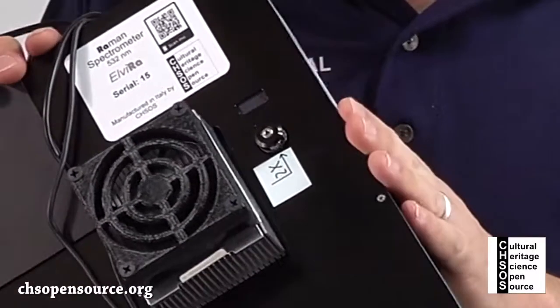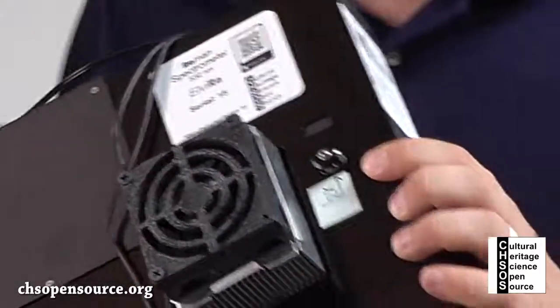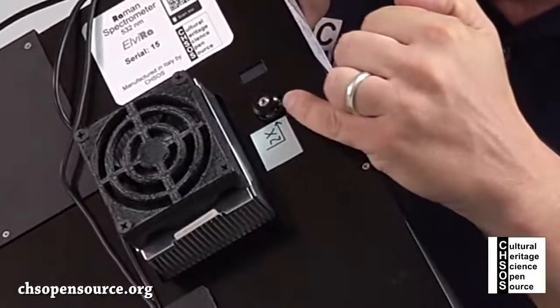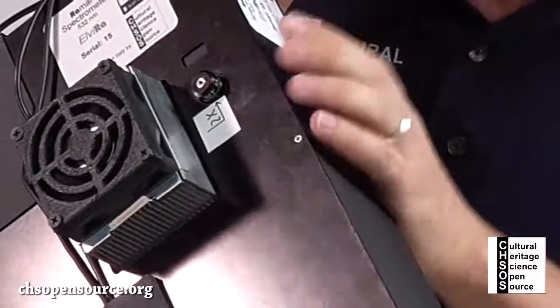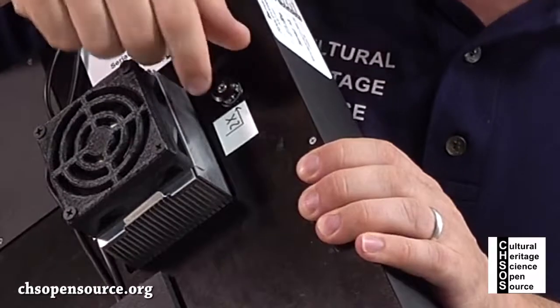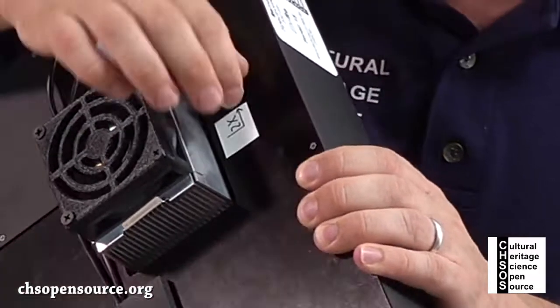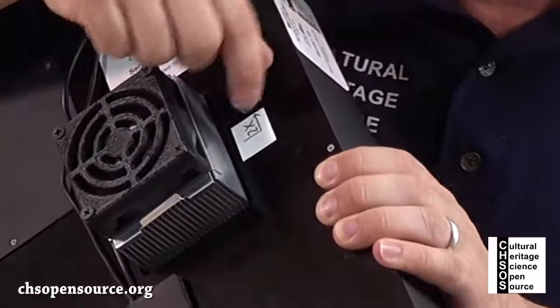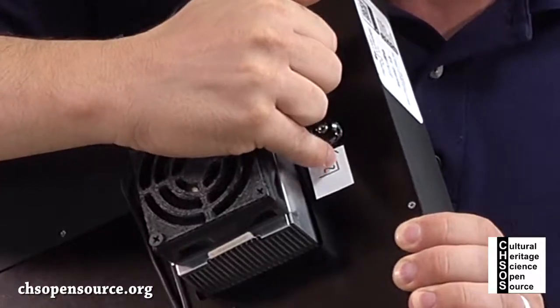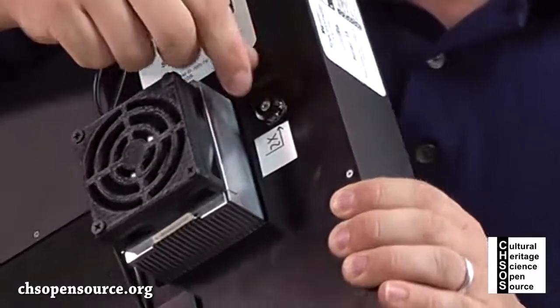Generally, when we ship the instrument, you will read here there is a 2, for example, 2x or another number, and so this will be the correspondence position where you will find your system when you receive it. So in case accidentally you turn this knob, you know that you have to follow this link over here. 2x corresponds to the 2x over here on the knob.